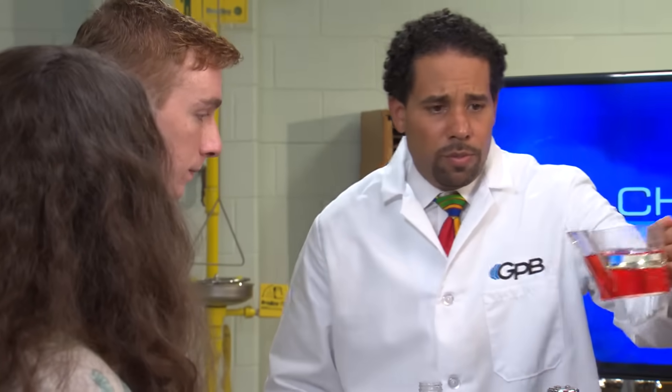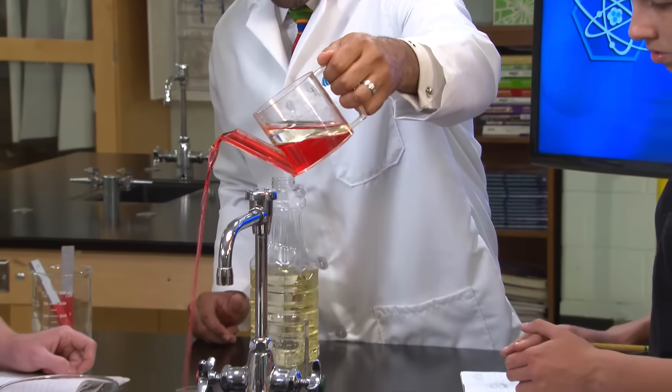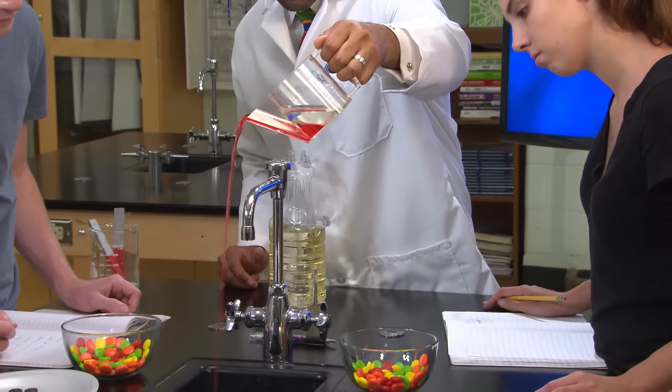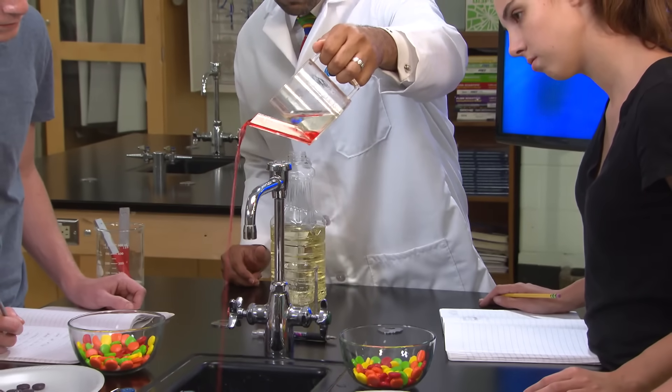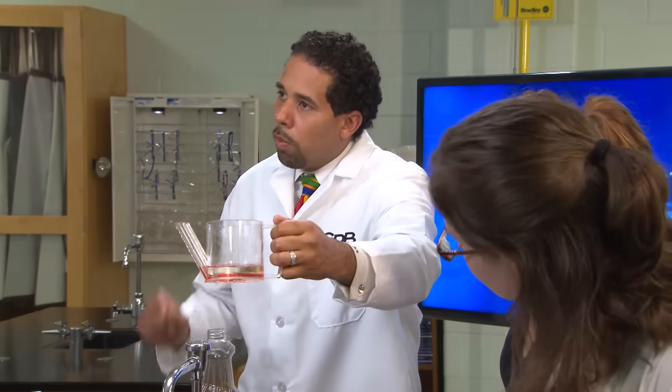Since liquids can have different densities, as you see in this combination of red water and yellowish vegetable oil, it's pretty easy to separate the oil, which floats on top from the water, because water is denser than oil. See how only the red water pours out?